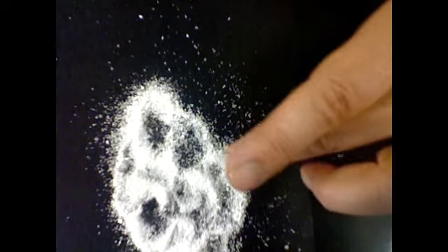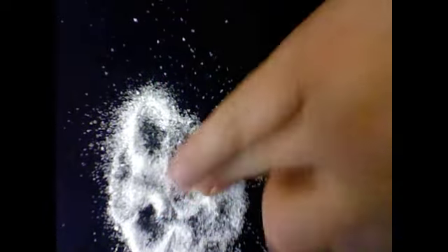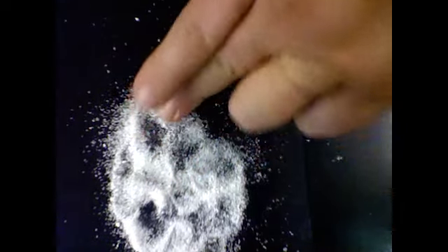I didn't try to break the powder because it was so small I wouldn't see it, but I think you are breaking some of it up. So it is fragile enough that we can break it up. Good to know.